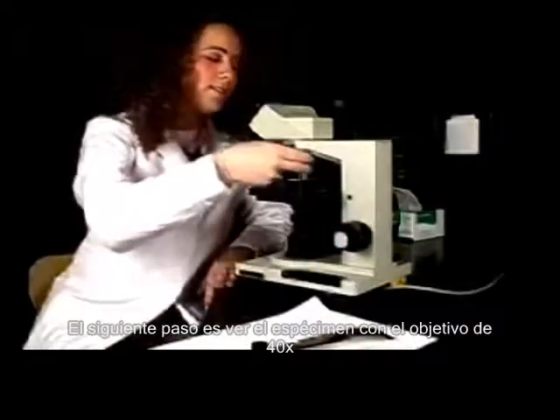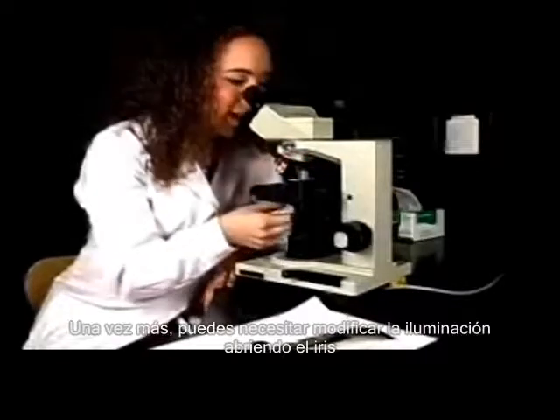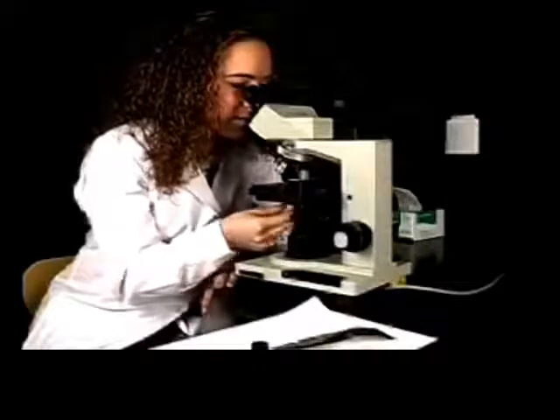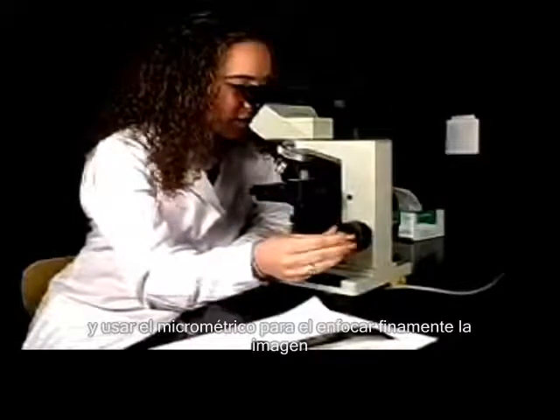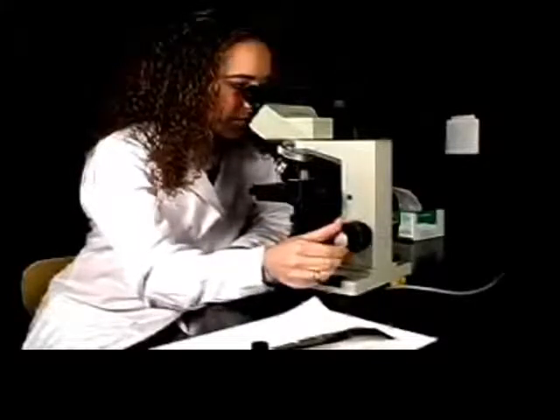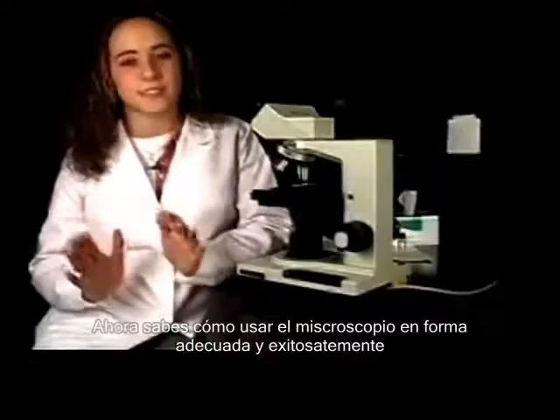Our next step is to view the specimen under 40x. Once again, you may need to make adjustments with the light by opening the iris and using the fine focus to get a sharper image. You have now learned how to use the compound microscope properly and successfully.